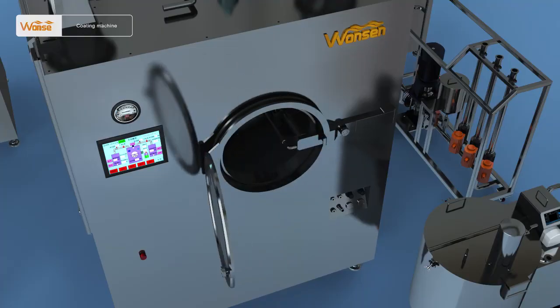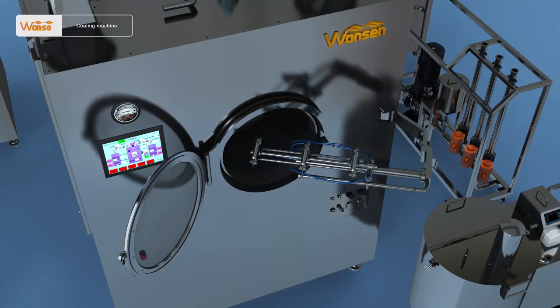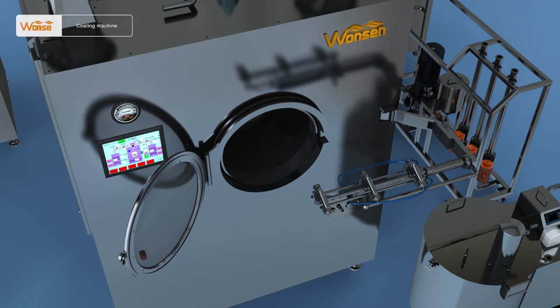Third, flow adjustment. Take out the spray gun arm. Adjust the spray gun to make the flow and atomization effect of all spray guns the same.